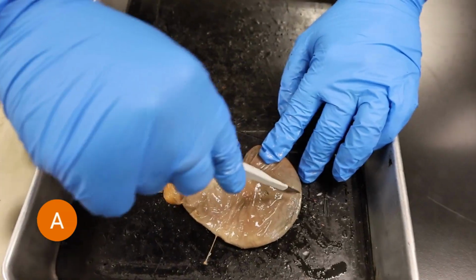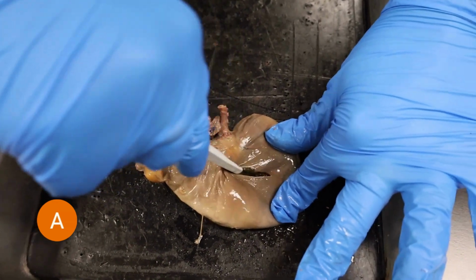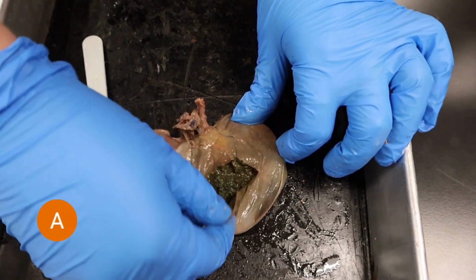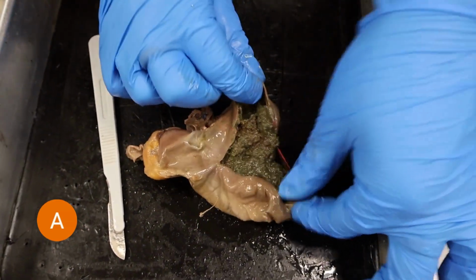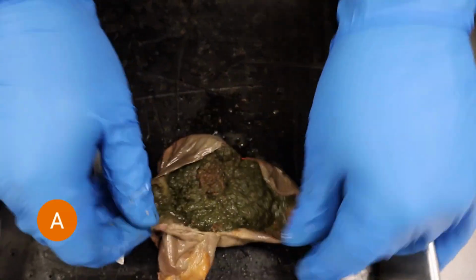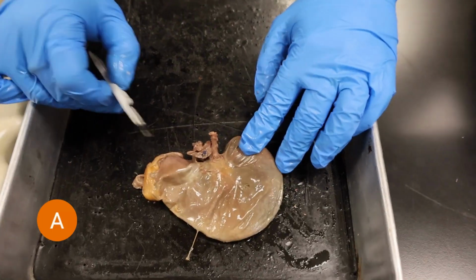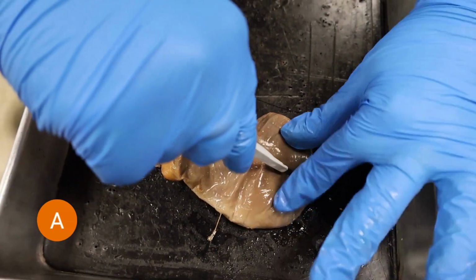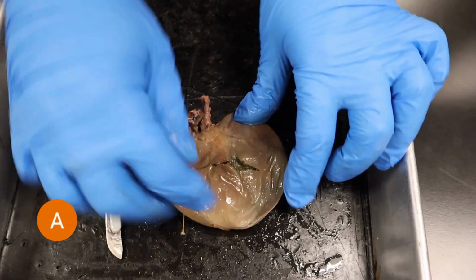Okay, so in this clip, Emily is actually cutting open the stomach, but I did want to discuss the cecum a little bit further and its great importance in rabbit digestion. Rabbits consume a lot of cellulose as they are herbivores and consume a lot of plants, except mammals are not able to break down cellulose, and so that's why it has that adaptation of having a cecum as one of its organs. The cecum does release microbiomes into the rabbit that allow it to digest cellulose more efficiently. Rabbits do consume their own waste as they need to digest it multiple times, but the cecum allows it to break through that cellulose and absorb as many nutrients as possible.